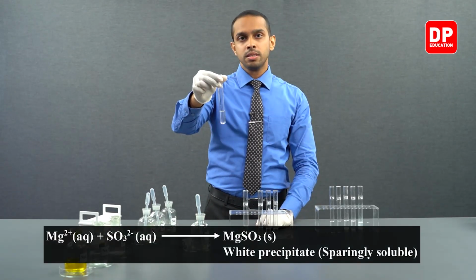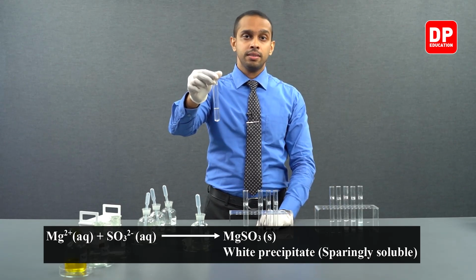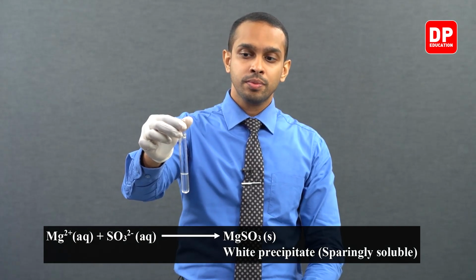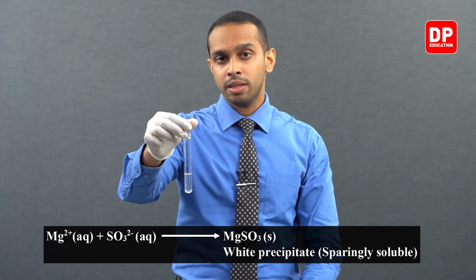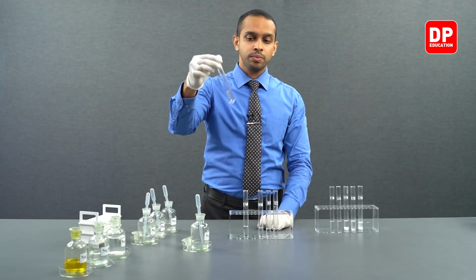Magnesium 2 plus ions, when in contact with sulfite anion, will form magnesium sulfite. Magnesium sulfite is a white color precipitate that is sparingly soluble or slightly soluble in water.